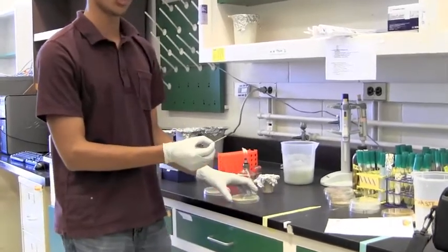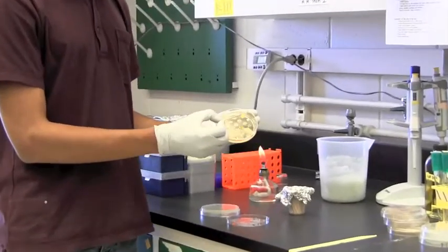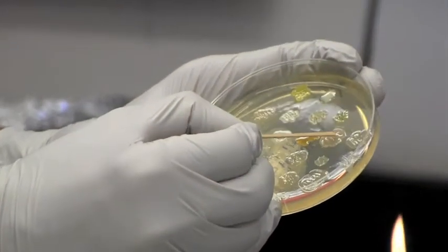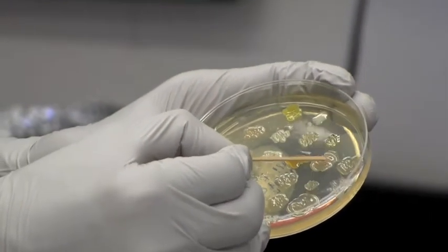And carefully we're going to scrape up a little bit of our isolate of interest that we want to test against a tester strain.